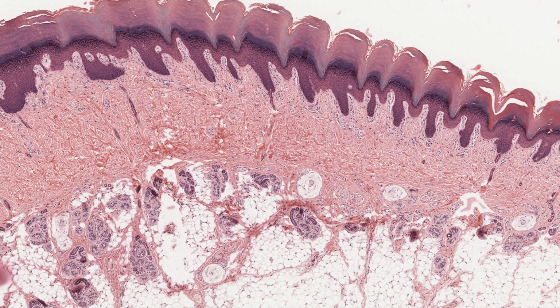Because the secretory portion and part of the duct are highly coiled, you can easily find clusters of randomly orientated sections of both. It's worthwhile looking at profiles cut at various angles. I'm now going to show you one of these sweat glands at a higher magnification.